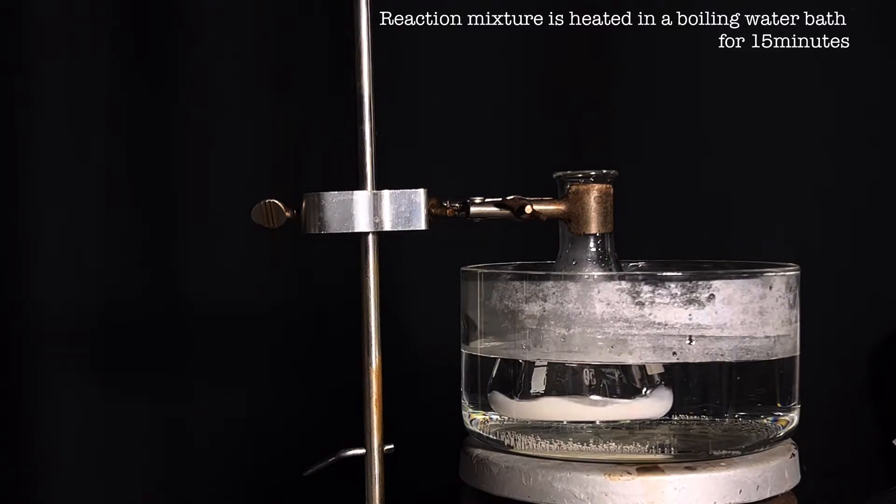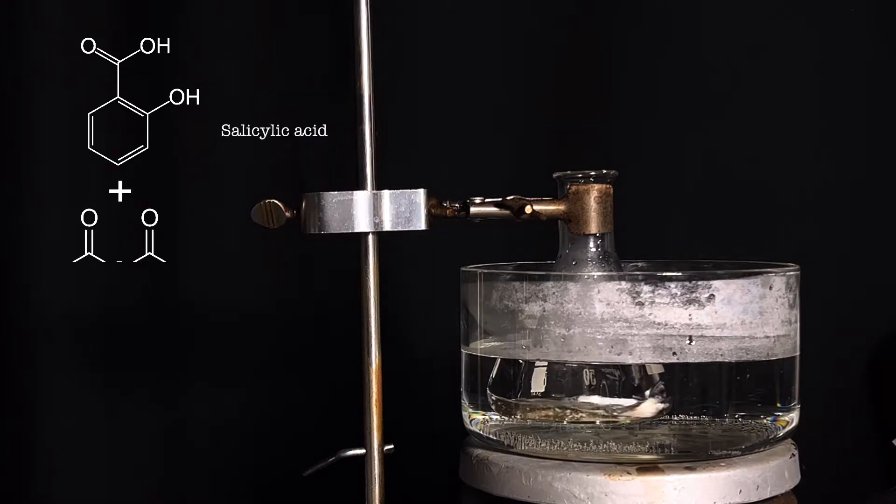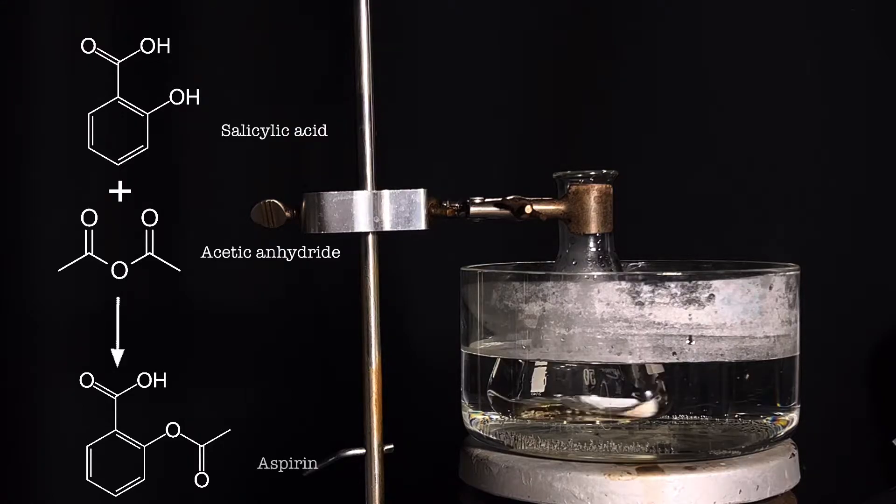Continue heating for approximately 15 minutes. This is when the reaction proceeds to completion. What is happening here is the acetylation of salicylic acid using acetic anhydride as the acetylating agent.